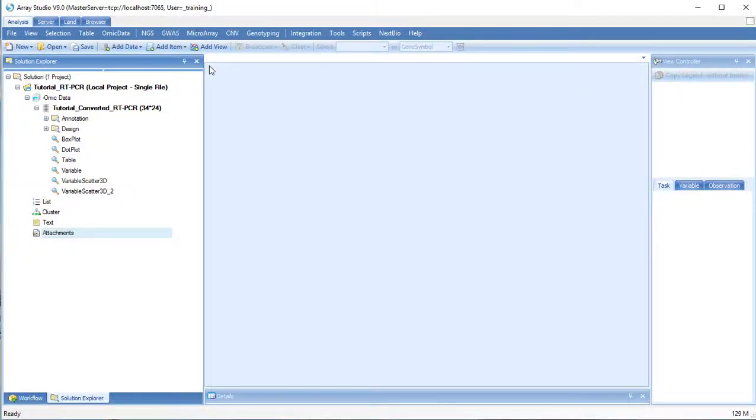Sometimes a single assay or sample experiment fails and should be removed from downstream analysis to allow more sensitive and precise detection of real differences. These failed experiments can be detected and easily removed from Array Studio data objects.